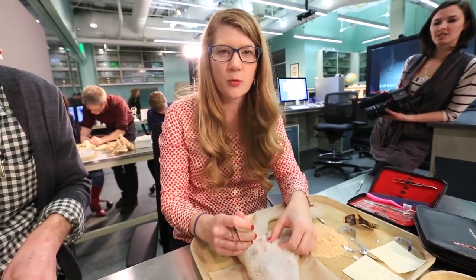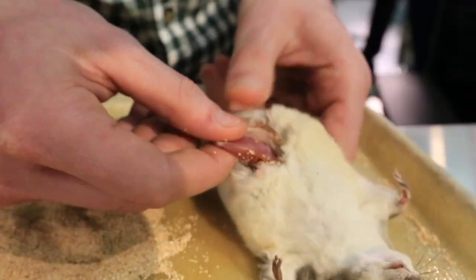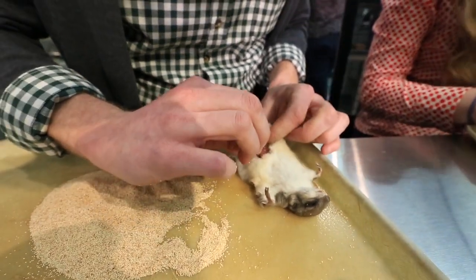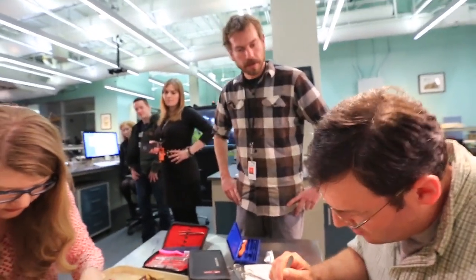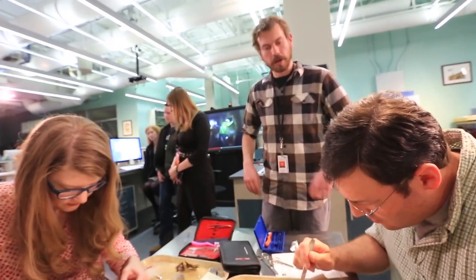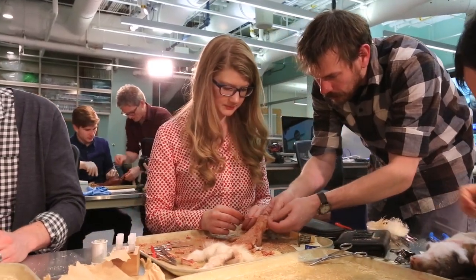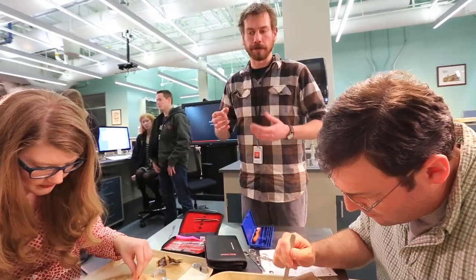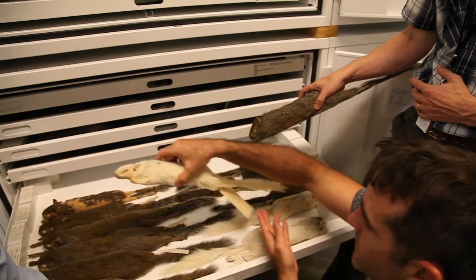Then you start turning the squirrel inside out through that hole. It's slippery in here — everything's kind of wet and gooey, so the cornmeal creates more traction. We don't call what we do taxidermy because we're not so much interested in creating a lifelike replica of a living animal as we are creating a specimen that fits well into a drawer and demonstrates the qualities of the skin we're really interested in.